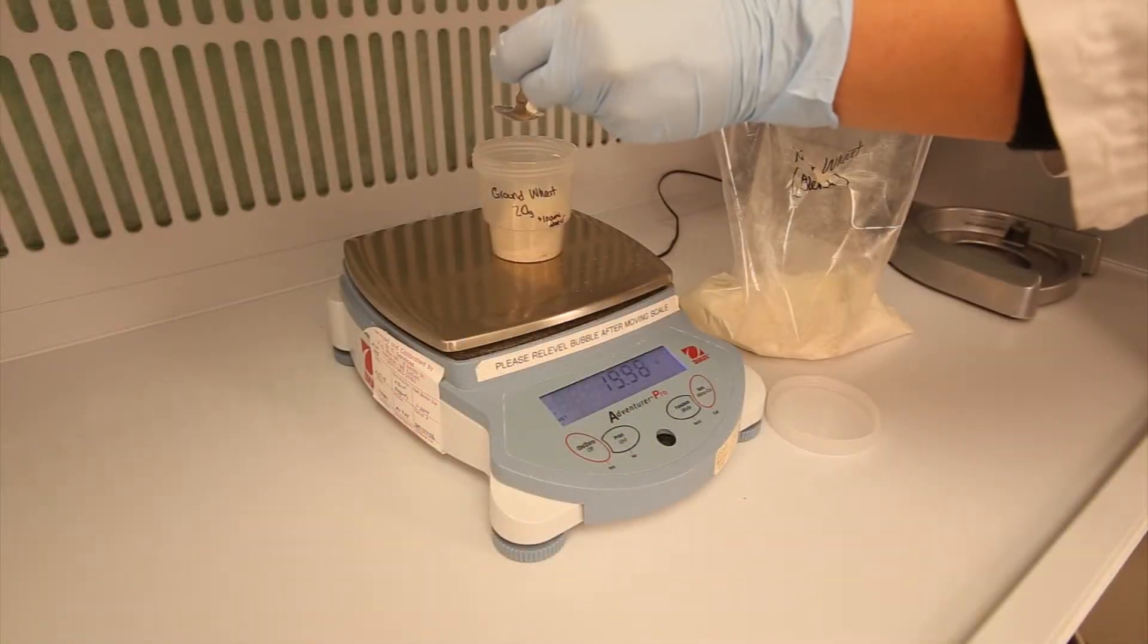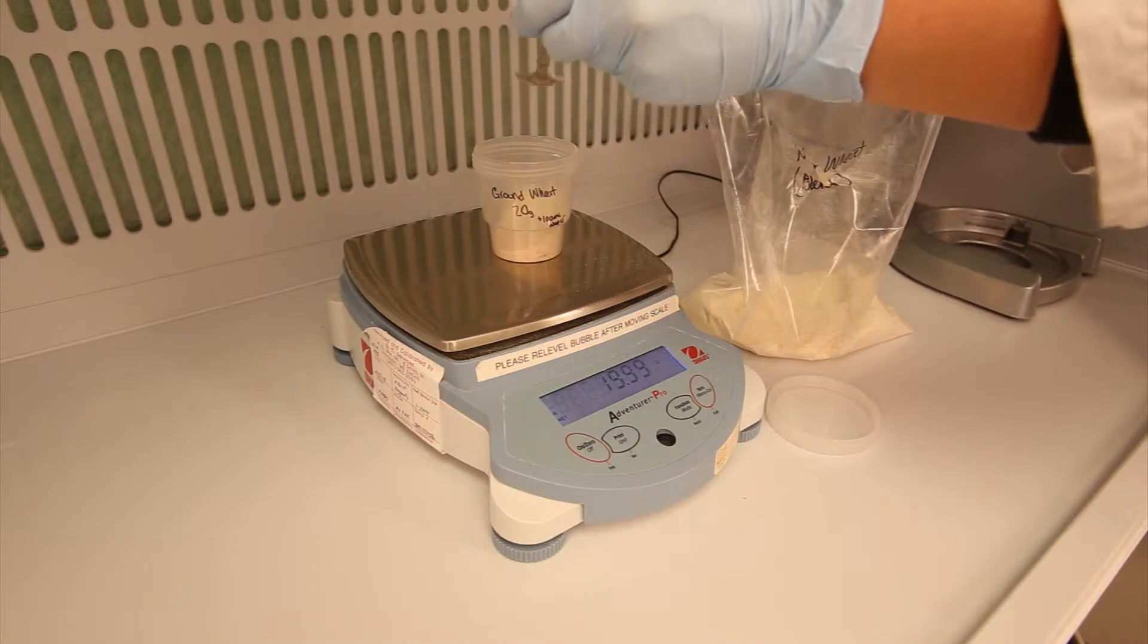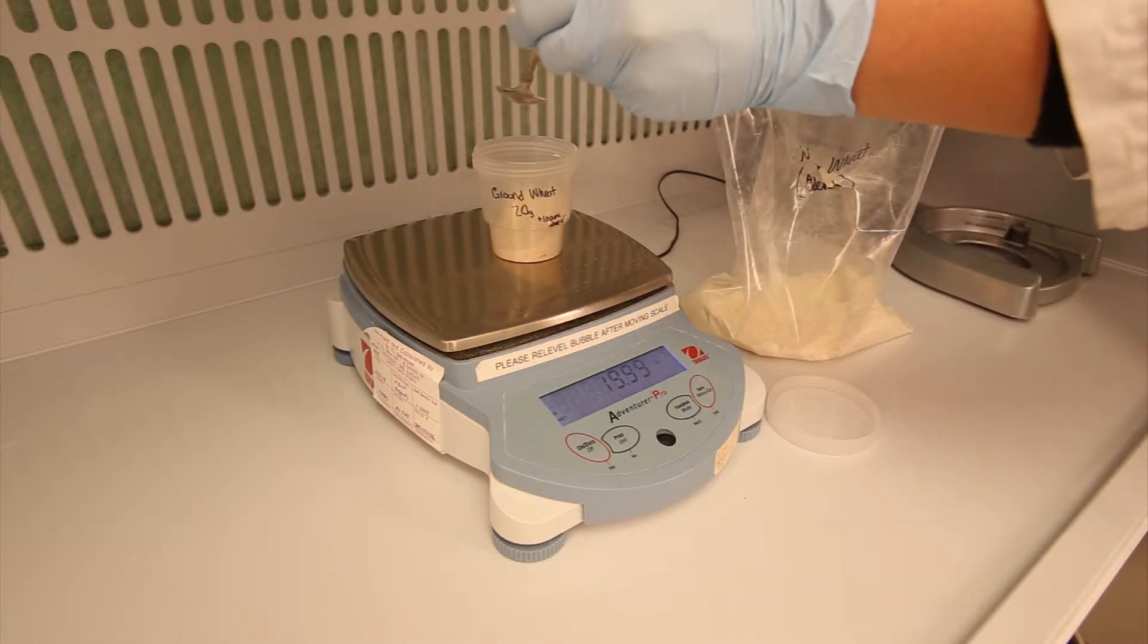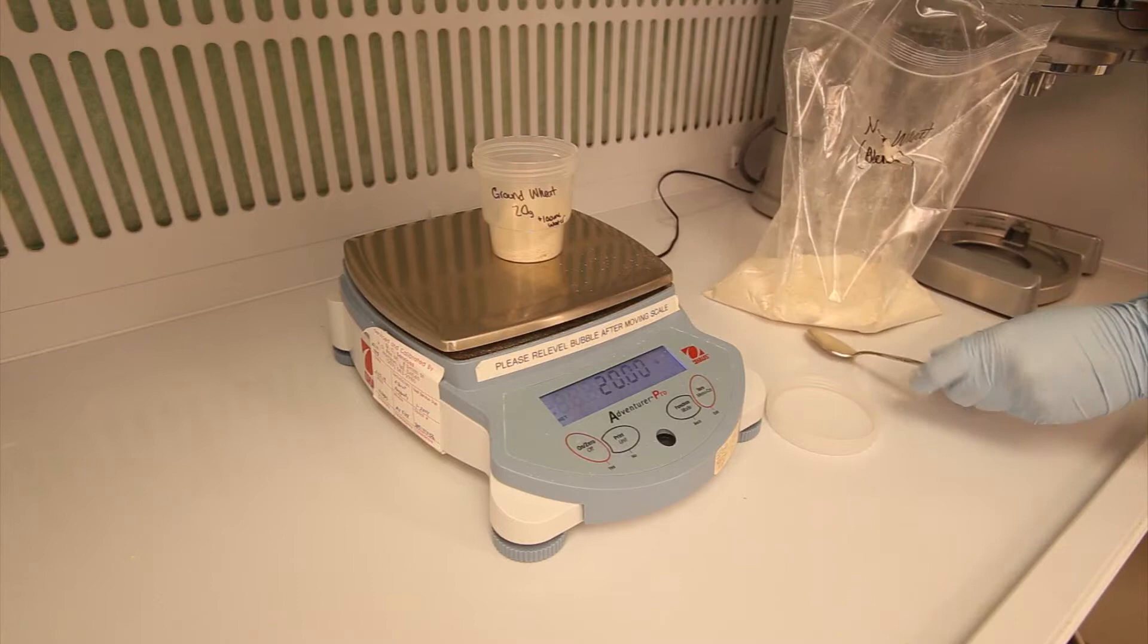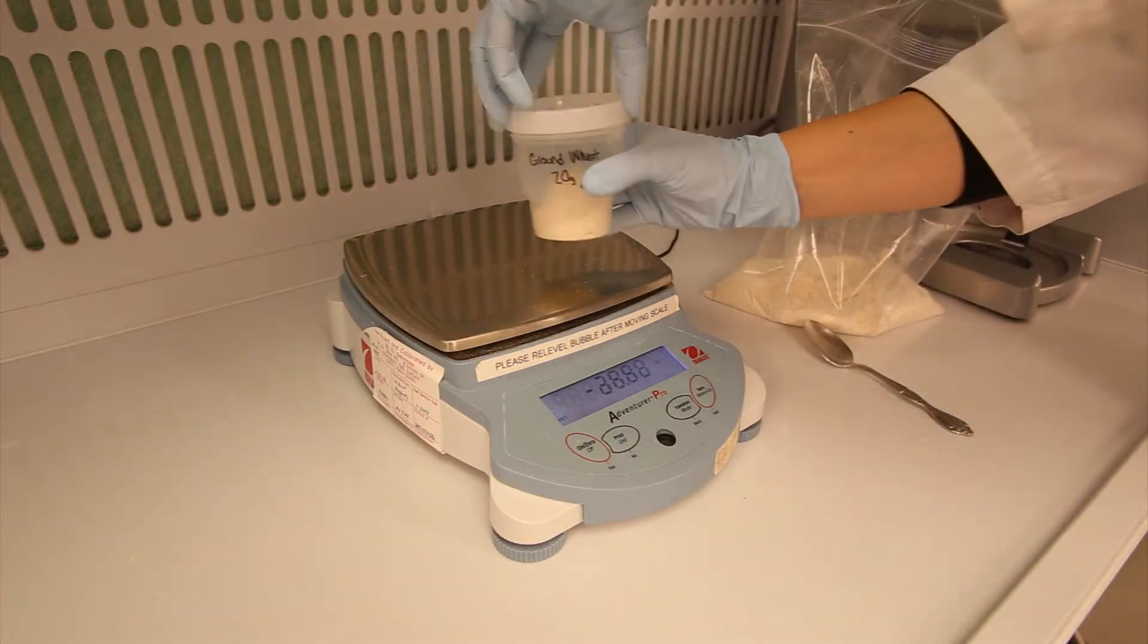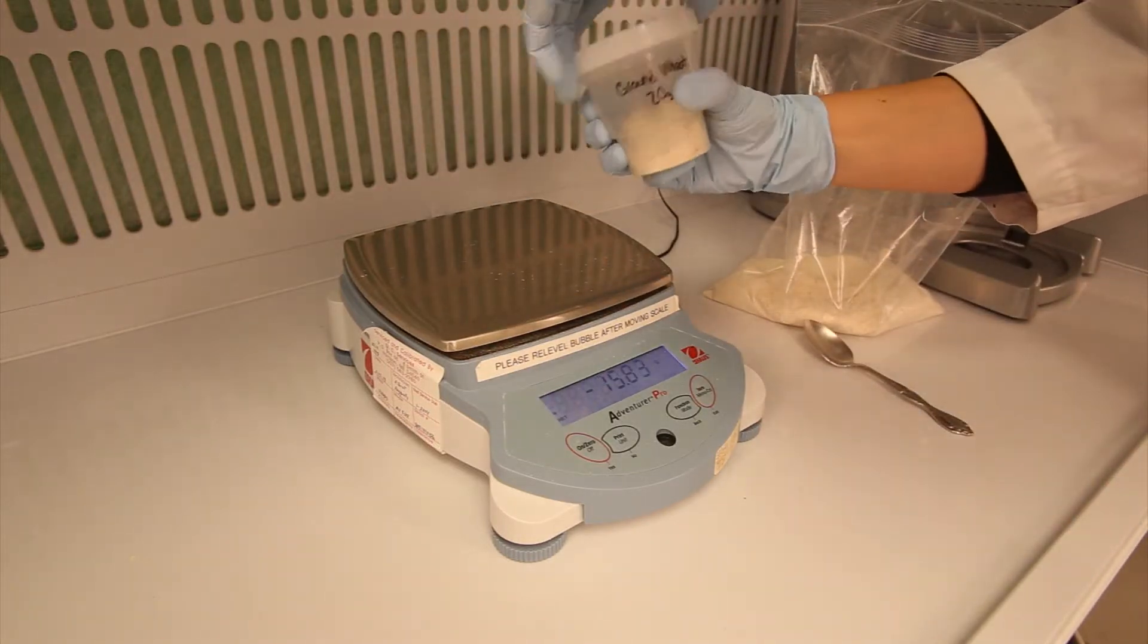Before beginning your test, be sure to properly weigh a fresh subsample. Account for the weight of your sample container. For best results, be as accurate in your sample weight as possible.